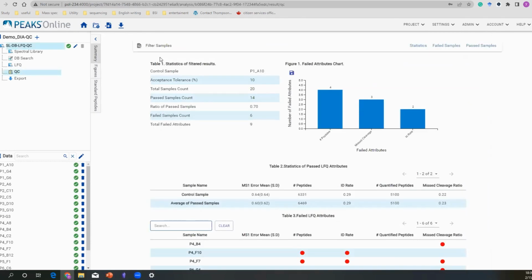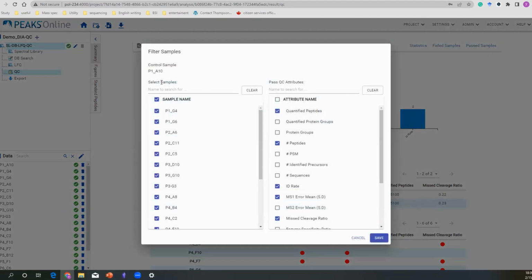Here is the summary view of our attributes. You can see this is something you saw before in our talk, but I want to go over this filter tab first. In here, you are seeing what kind of attributes you would like to watch, and what kind of samples you would like to be involved in this QC process. In case you have a very large sample size, you can use this search button. For example, here I would like to only check the samples from plate, let's say plate 3. So just simply click plate P3. It's right there. You can just select them all or deselect them to make things easier for you.